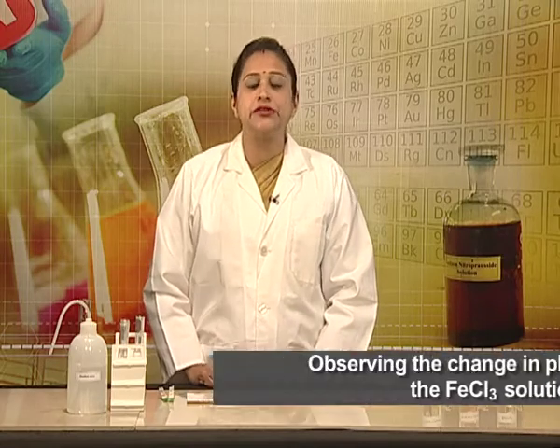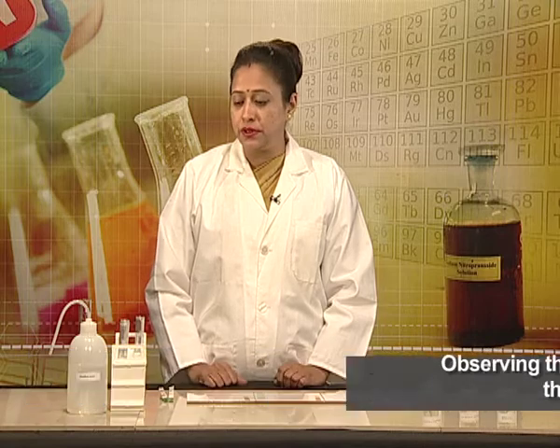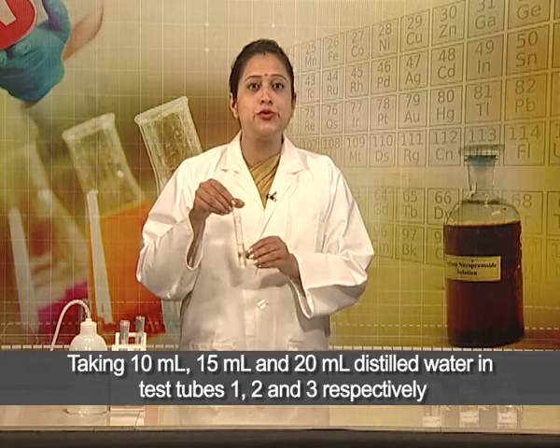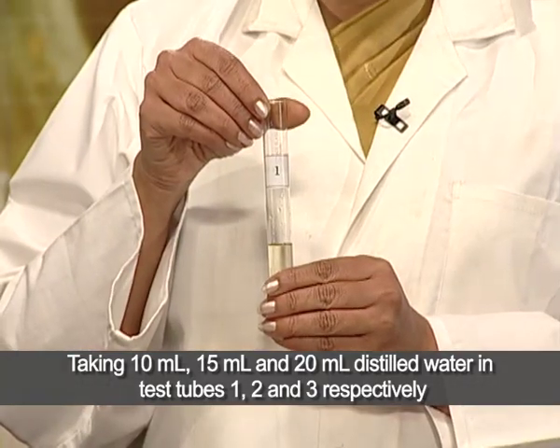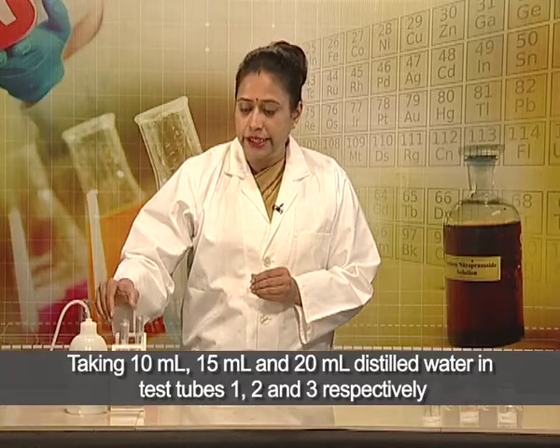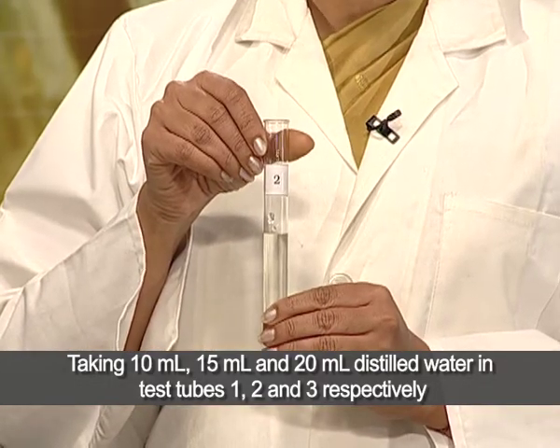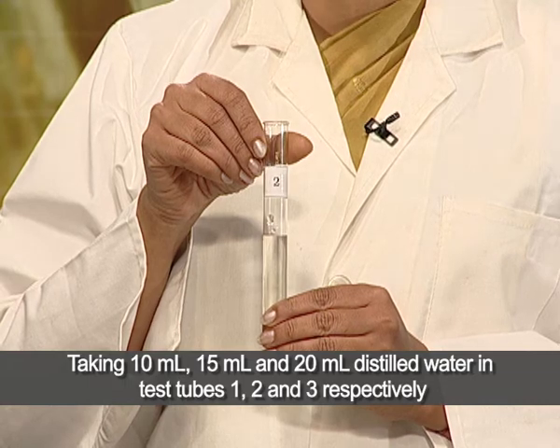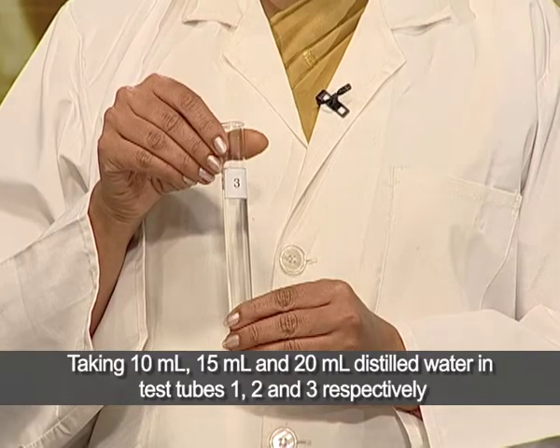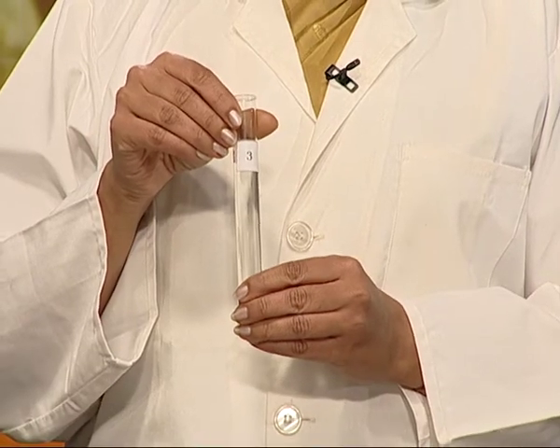Let us now proceed with our second solution — ferric chloride — and study the effect of dilution. Again we have prepared three test tubes. In test tube number 1 we have taken 10 ml of distilled water and 1 ml of ferric chloride solution. In test tube number 2 we have taken 15 ml of distilled water and 1 ml of 0.1 molar ferric chloride solution. Test tube 3 contains 20 ml of distilled water and 1 ml of 0.1 molar ferric chloride solution. We have shaken the test tubes.